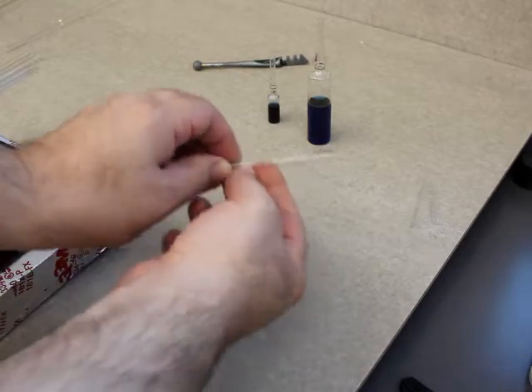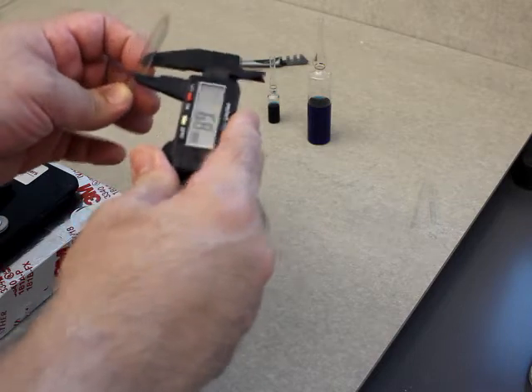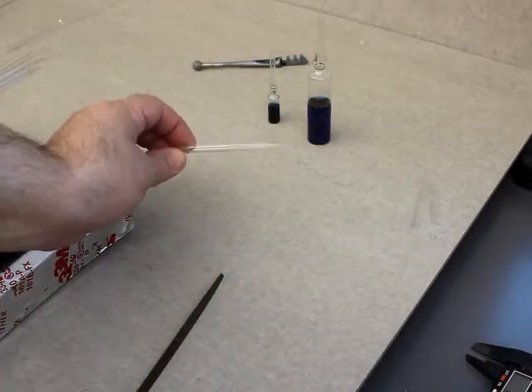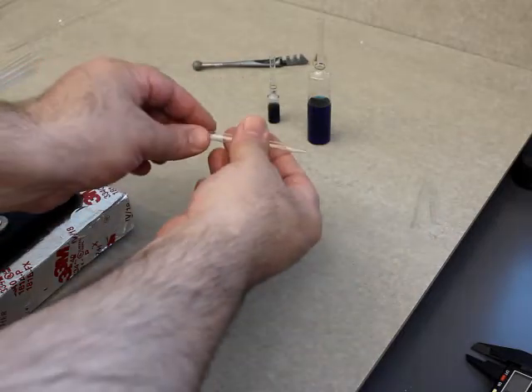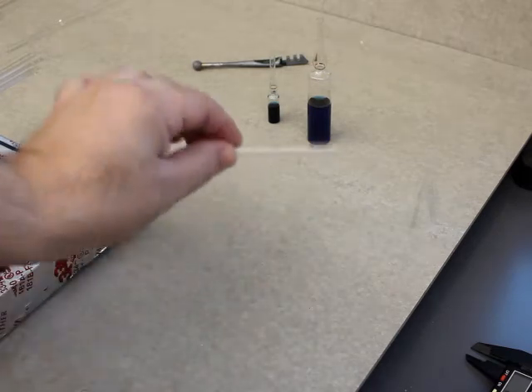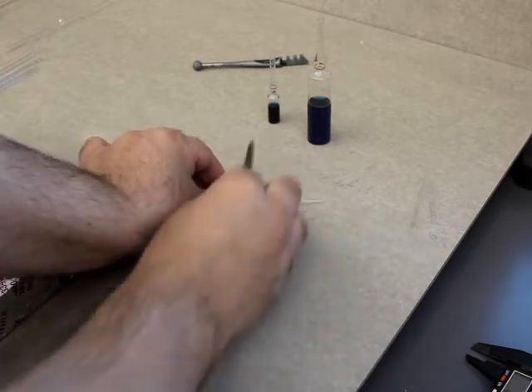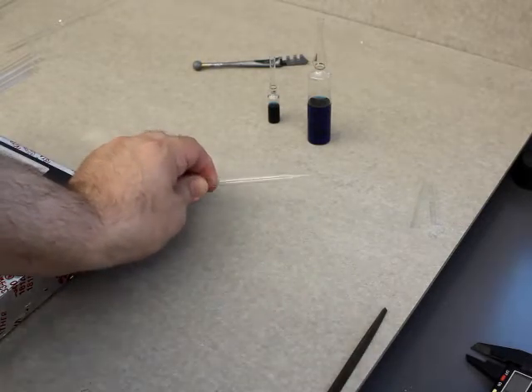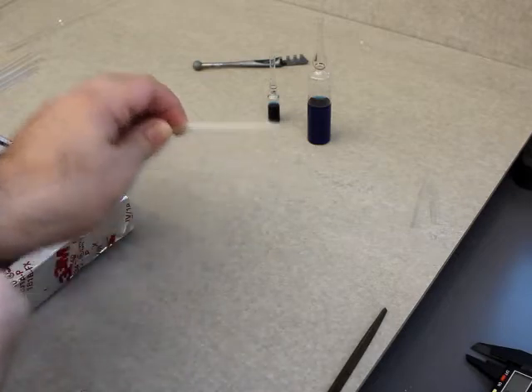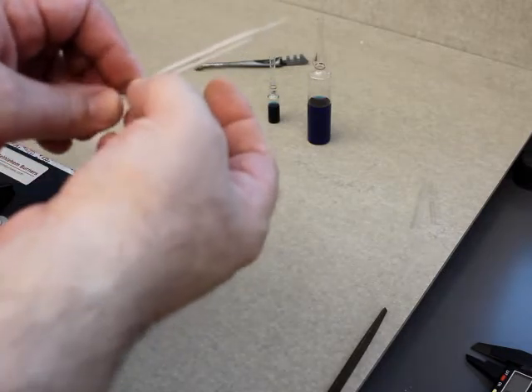This is very thin glass, and the diameter of this tube is 6.8 millimeters — almost 7 millimeters. So it's not a very large diameter tubing; it's the disposable glass tubing. I put a little spit on there. I don't have to sit here and try to saw it. Once you've made a scratch, you should be able to pop it. Now, the thicker the glass and the larger the diameter, the better off you are if you give it a very good deep scratch and have it go around the circumference. It doesn't have to go all the way around — I typically try to go a quarter to halfway or thereabouts.